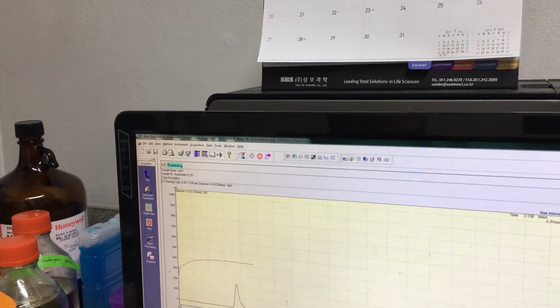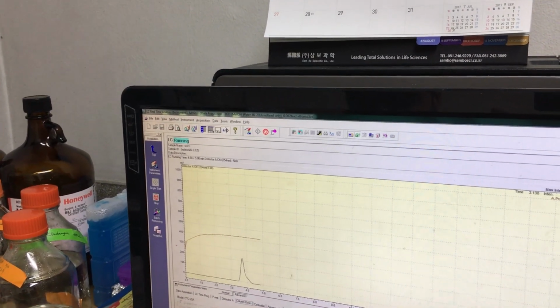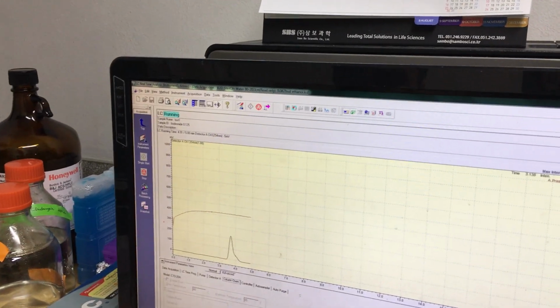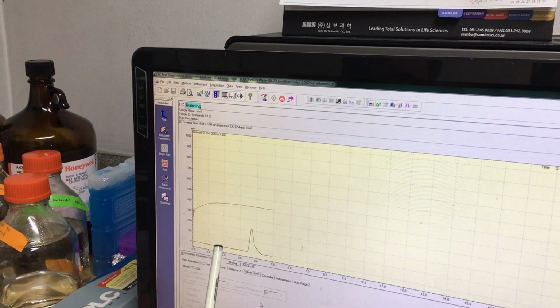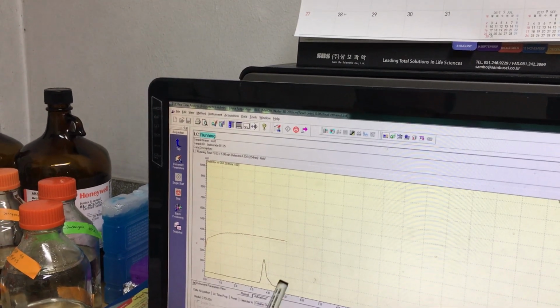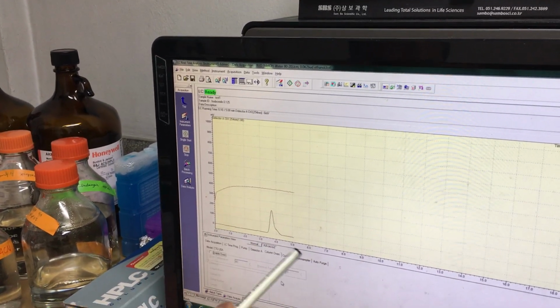Can I ask a question? So you mean that if we don't know the peak before, we have to wait. You need to optimize first. You can give 10 minutes, then you find, oh, my peak is here. Then reduce the time. No need to waste solvent. So this sample is finished, but if I use multi-sample, it will automatically start a new sample.